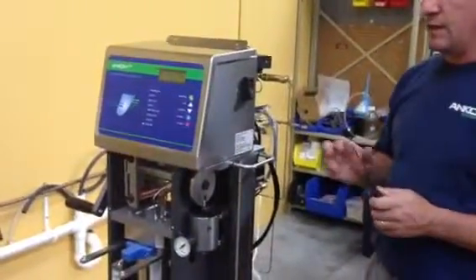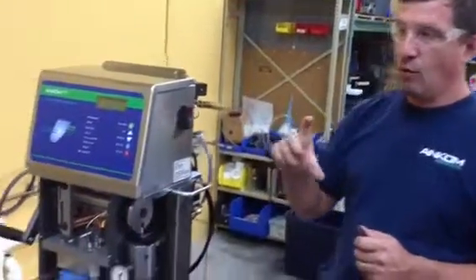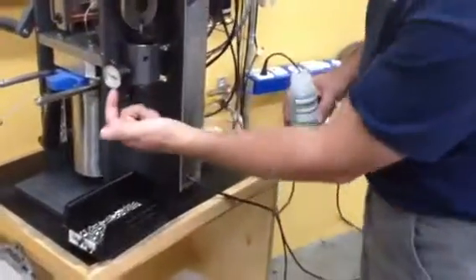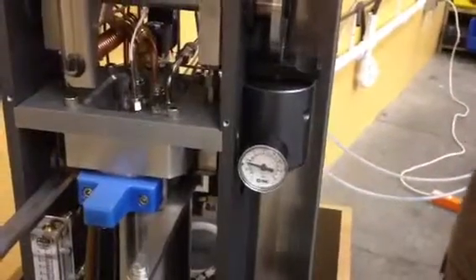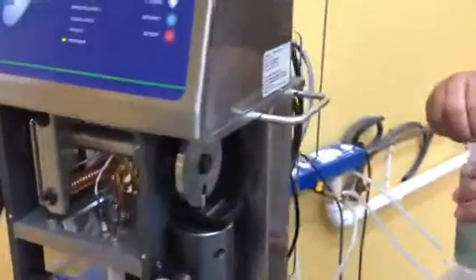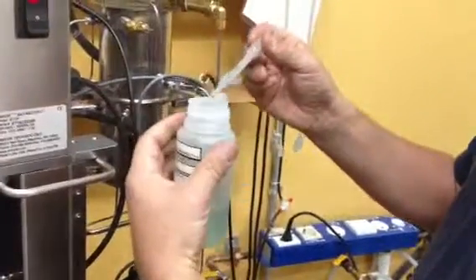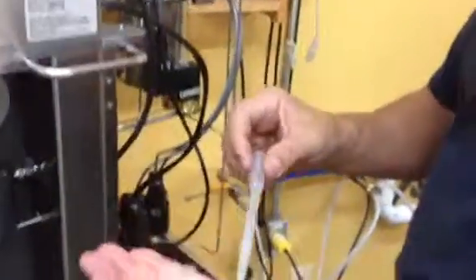During this, if you feel a suspect fitting that might be loose, I suggest you make a soap solution, or if you have a bubble solution for leak detecting, I recommend you doing that. I have an instrument here that is doing a run. My pressure is built up to approximately 40 psi now. So if I have a leak in any of these fittings, it should show up with some bubble solution. What I do is I'll mix a little detergent with warm water and make sure it's going to bubble up if you have a leak. So you want to see bubbles with it, okay?